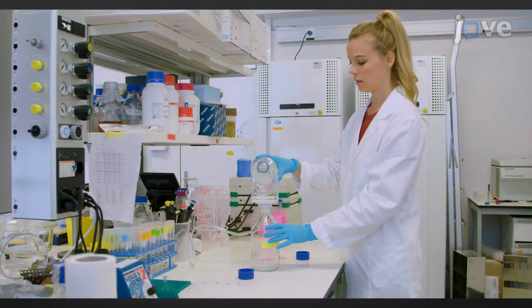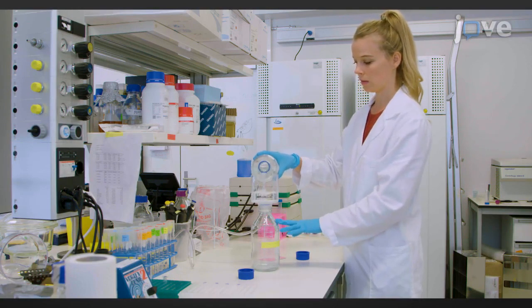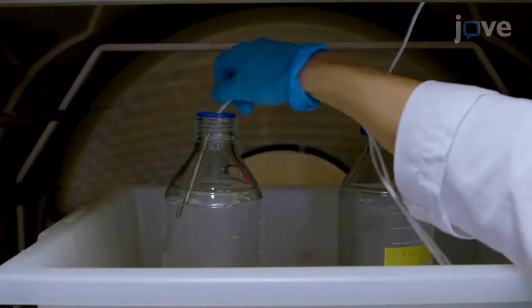Before preparing the chemoattractant, filter the medium with a 0.2 micrometer filter and autoclave the filtered solution.